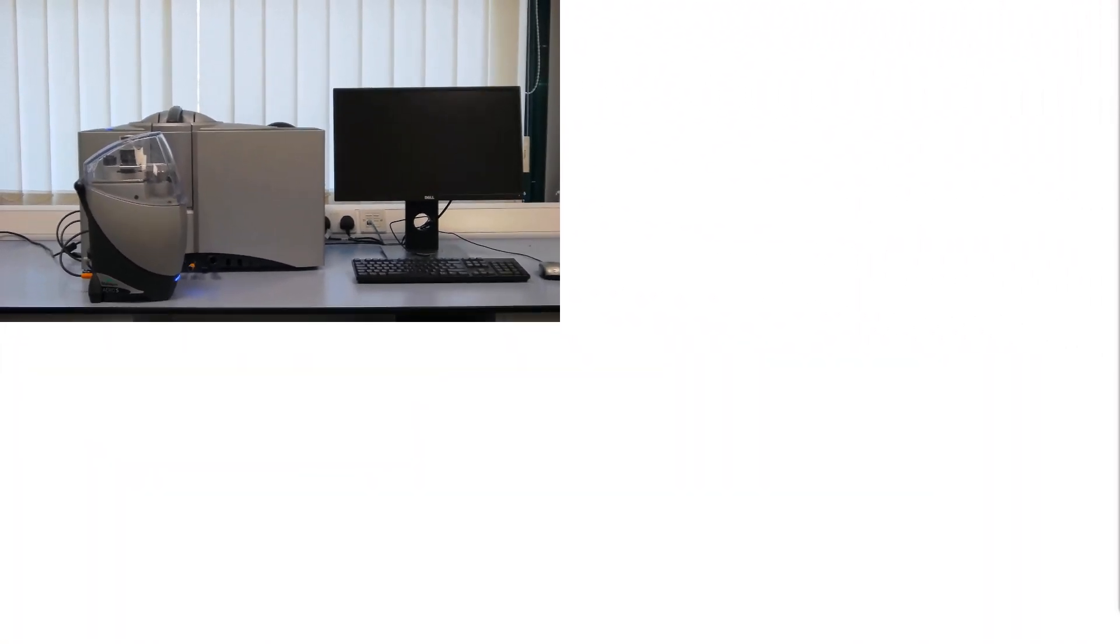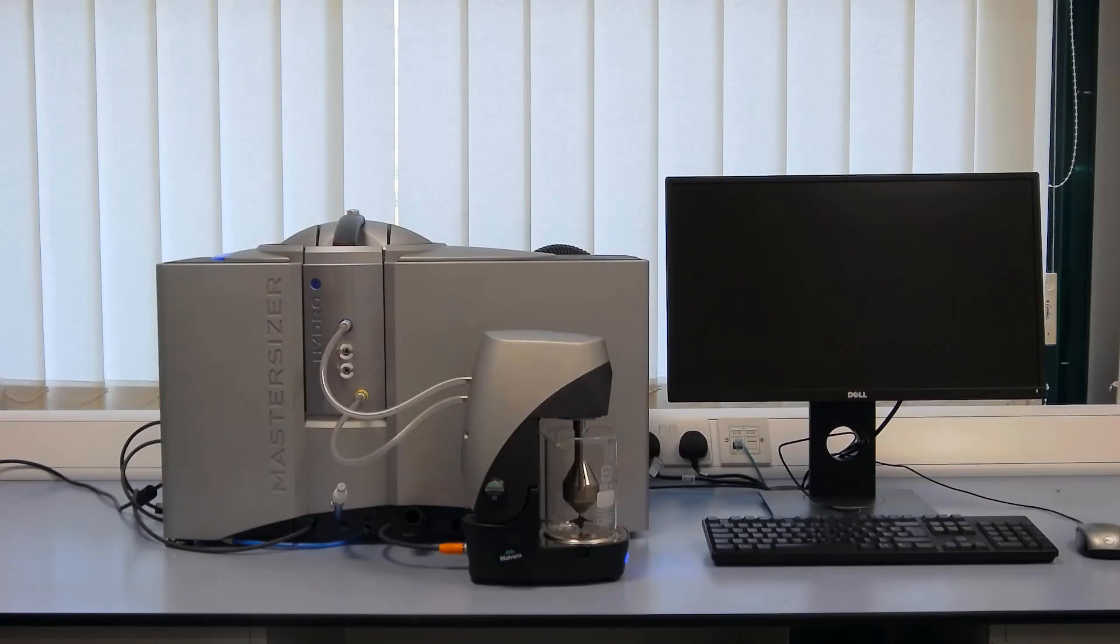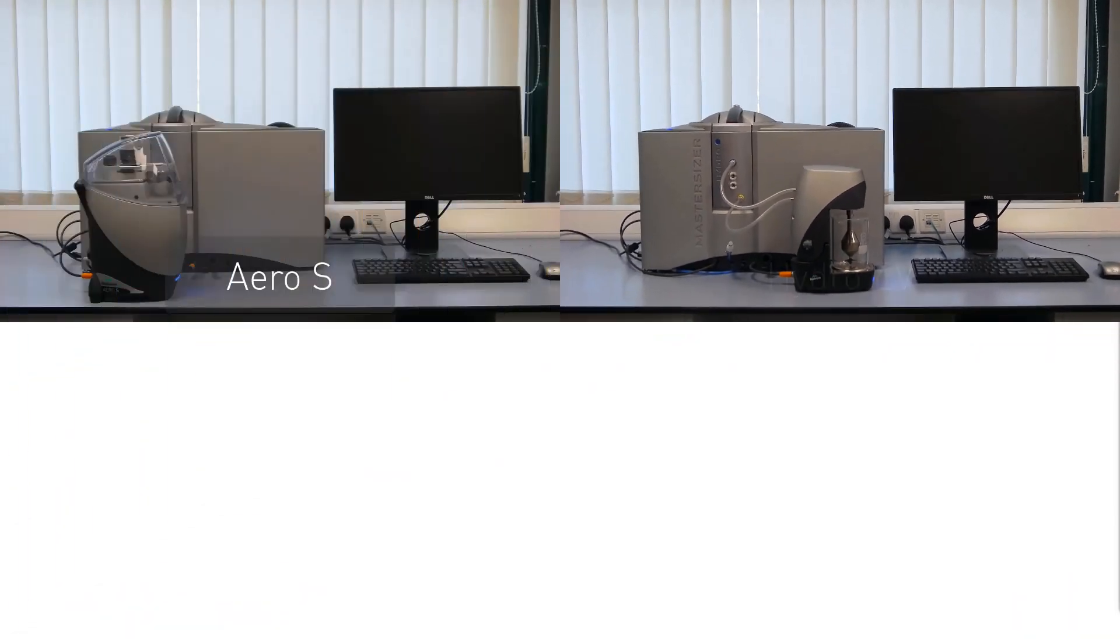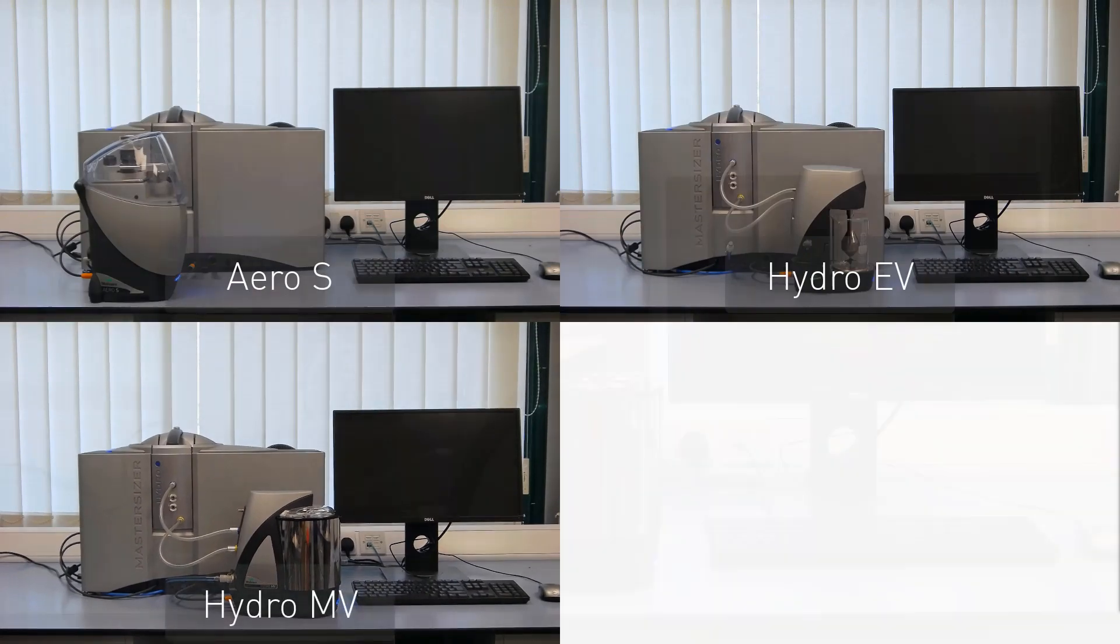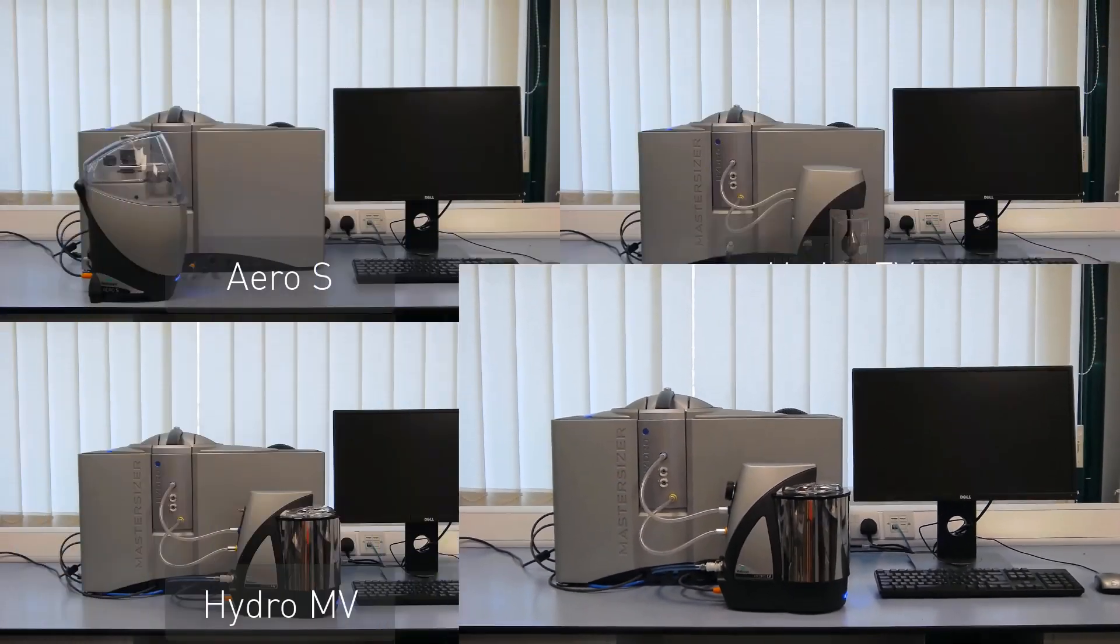Here we will cover both dry measurements using the Aero S dispersion unit, as well as wet dispersion measurements using the Hydro EV, the Hydro MV, and the Hydro LV dispersion units.